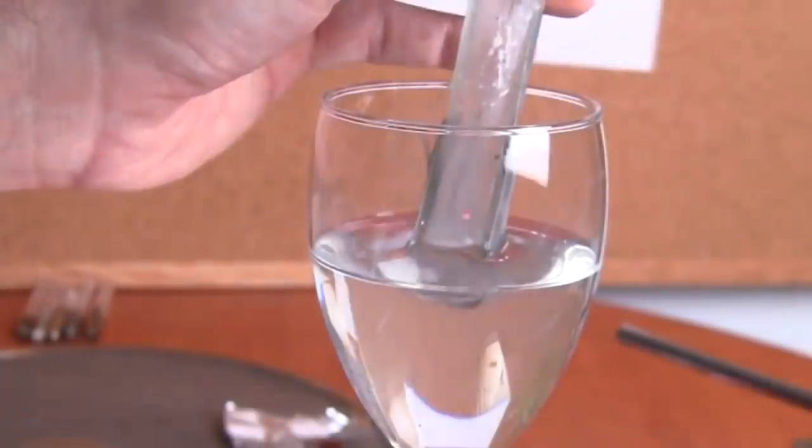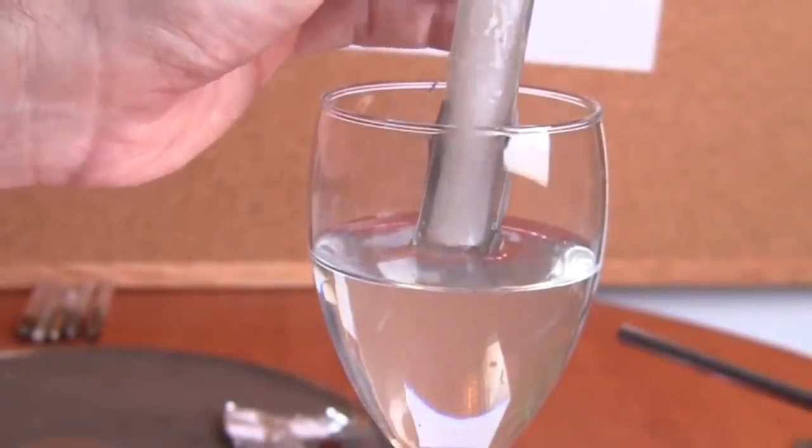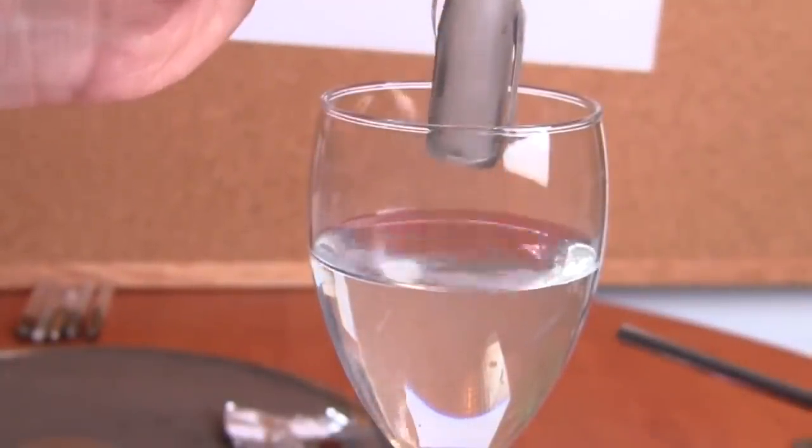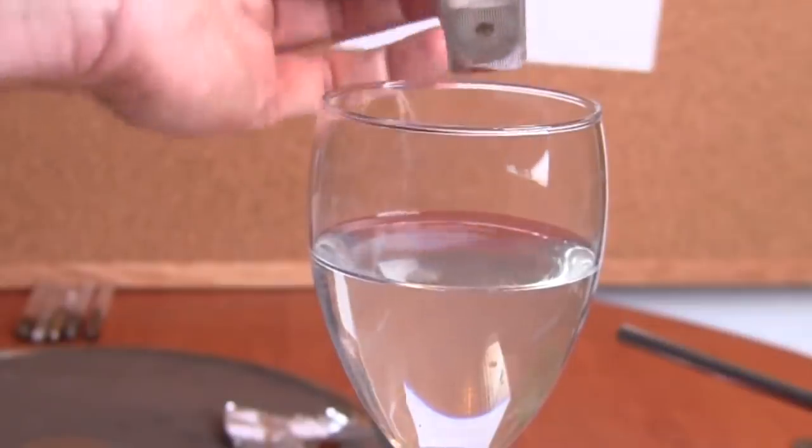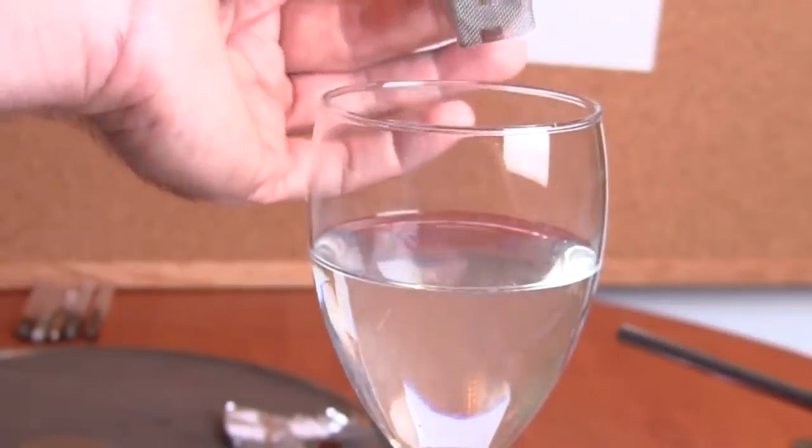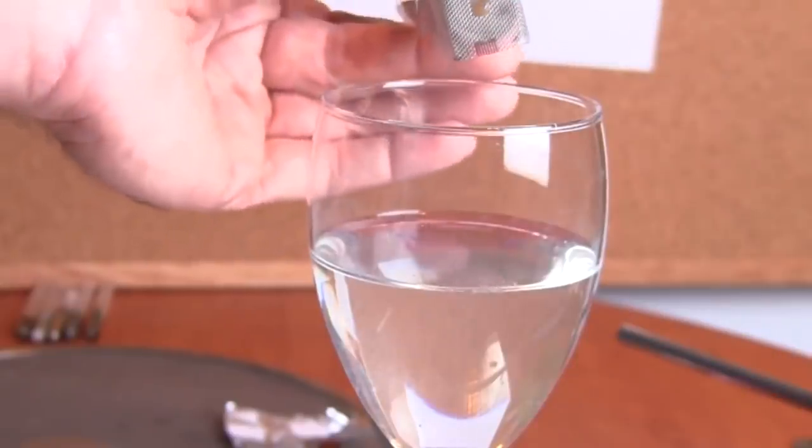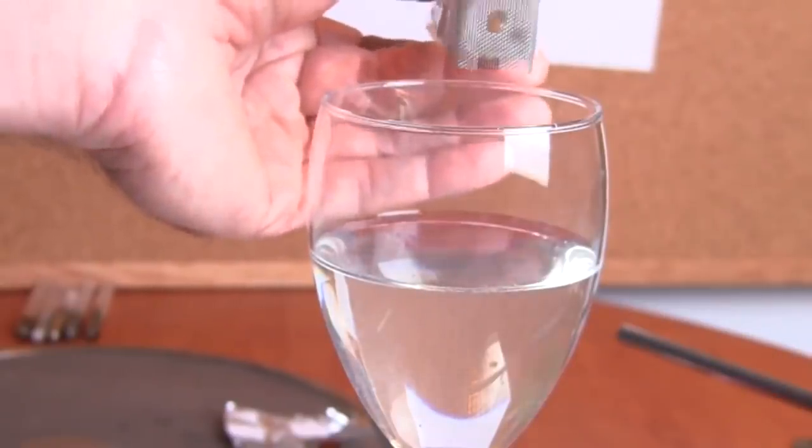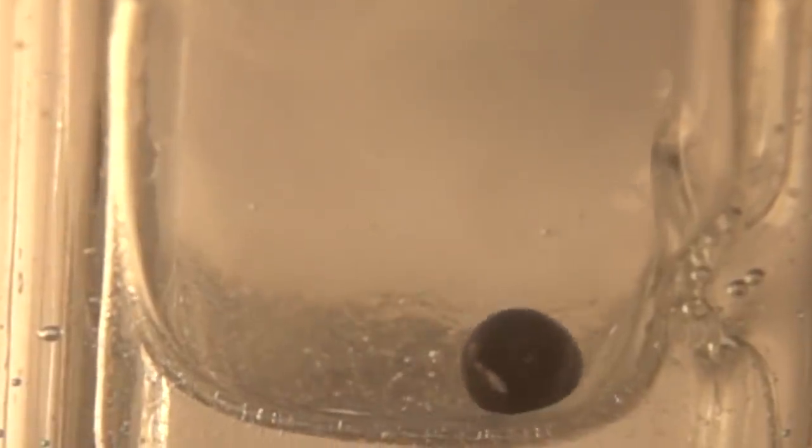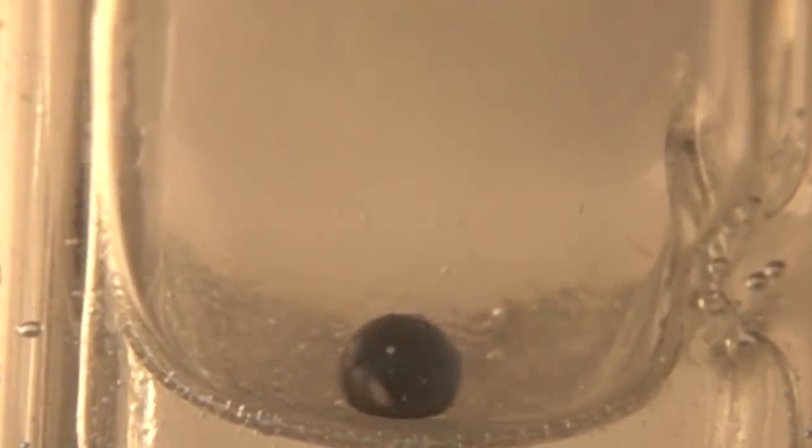Indeed, you can see just from this smoke given off by a typical reaction that a significant amount of the product ends up in the vapor. And indeed, in rare cases, you can actually isolate that drop at the end with various degrees of success and titrate it by its mass to work out the composition of it in terms of sodium hydroxide and sodium oxide. And it's comparable quantities of both, so about 50% of the oxide, 50% of the hydroxide.